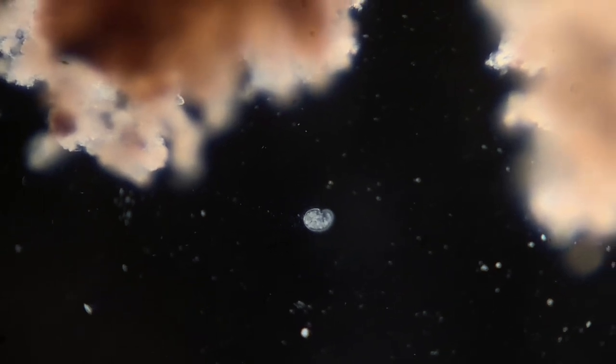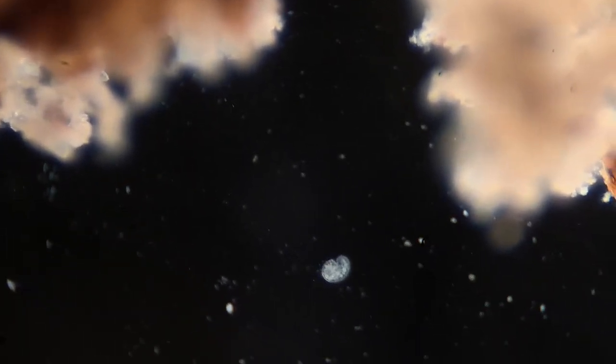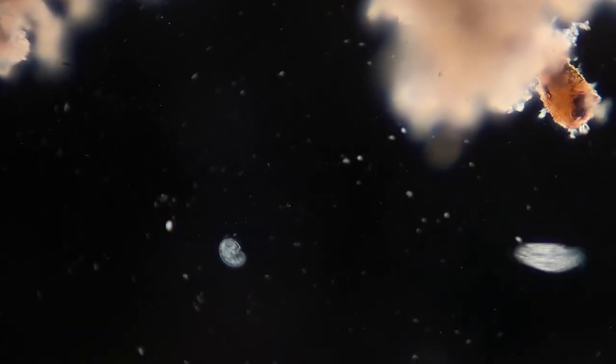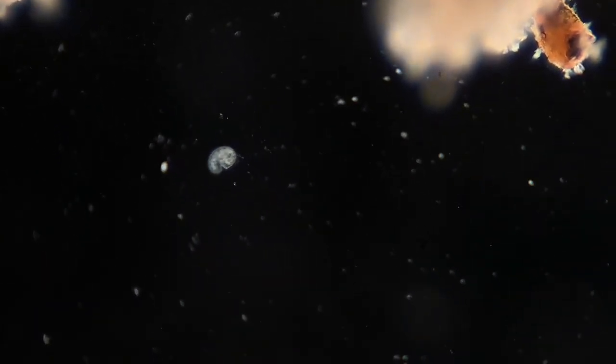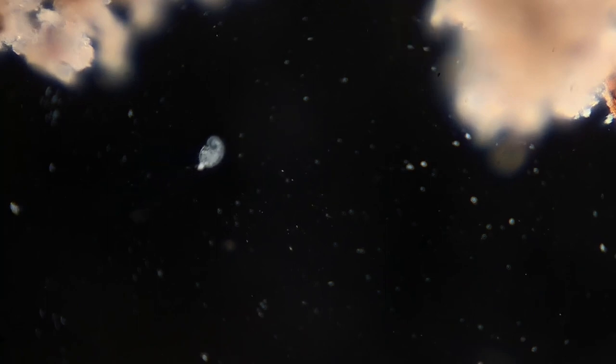There was a microorganism that I wasn't able to identify, mainly because it was pretty damaged. This one is almost cut in half, and you can see a lot of guts that are kind of following it as it swims along. It reminded me of Nearly Headless Nick, and in honor of it, I think we should name him Nearly Cellless Ciliate. That's it for the larger ciliates.